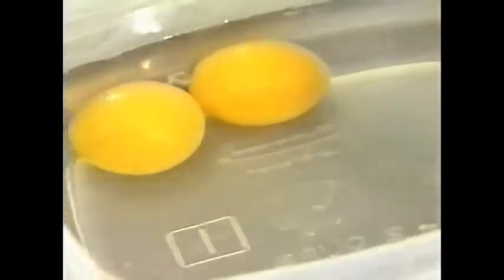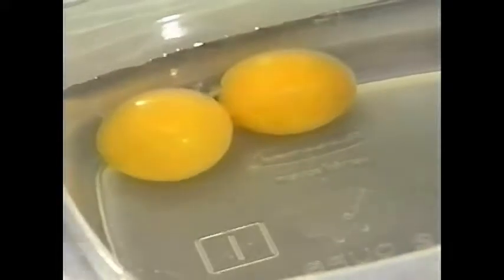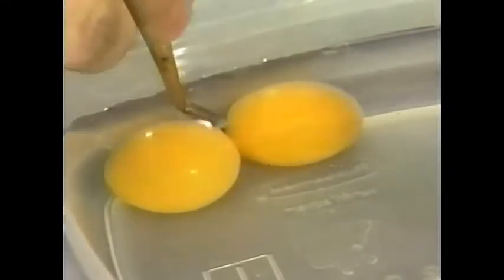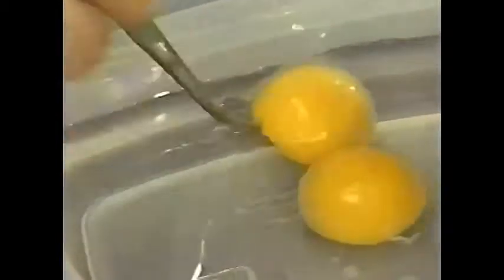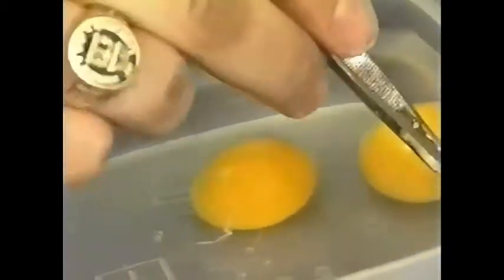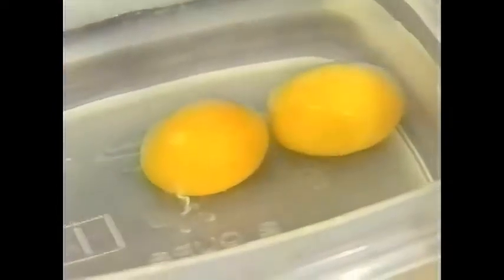Then submerge the paper towel in a sodium chloride solution — you can read about that in the write-up. We'll let them soak in this 5% sodium chloride solution for at least five minutes. Typically I'll have two, three, four, or six eggs in one solution, so as you put the last one in, you're ready to take the first one out.